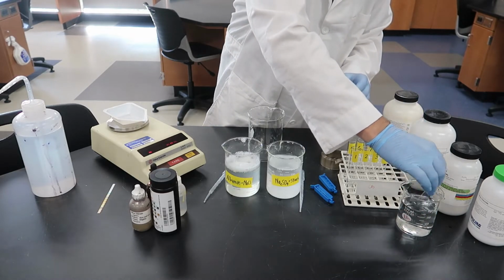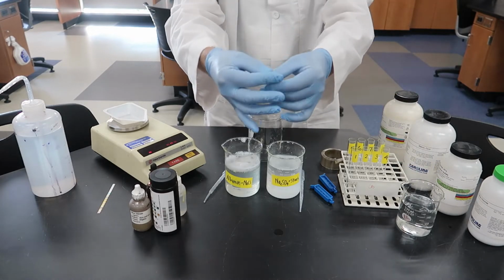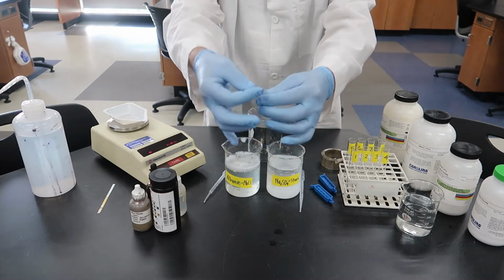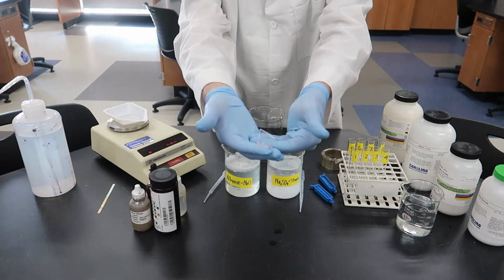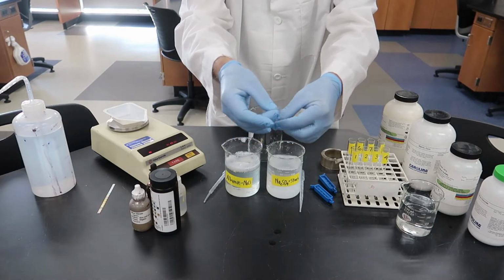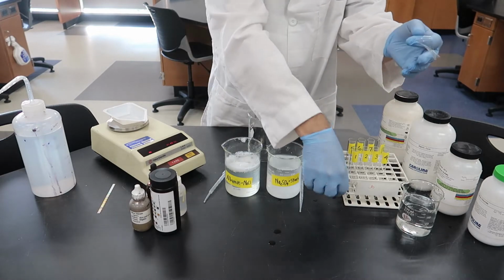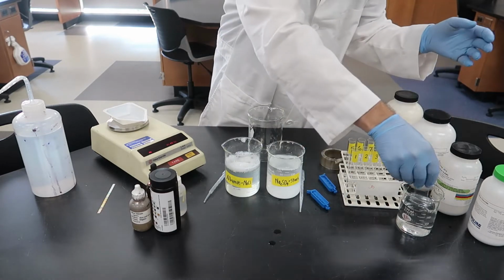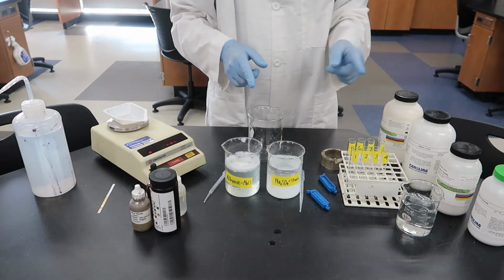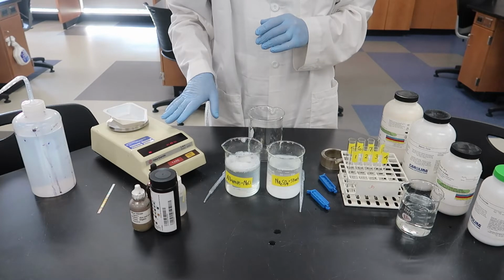They've been soaking so that makes it easier to open them up, and when you rub them between your fingers, you can see that they actually become a tube rather than just a strip. And this is a semi-permeable membrane, and we'll see what things can pass through it and which things can't. Now the blue things are clips that will go on the ends of the dialysis tubing to basically seal the ends off.